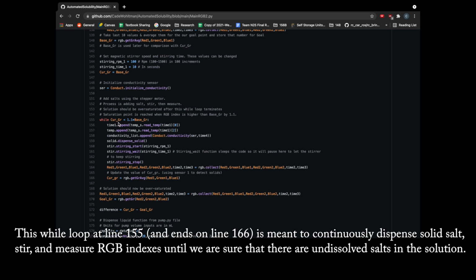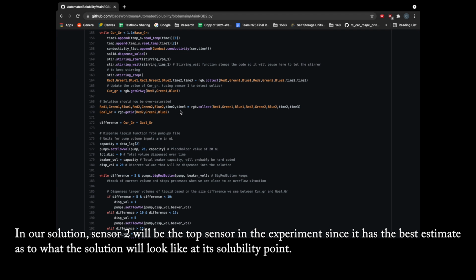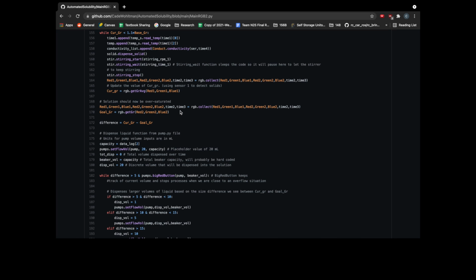This while loop at line 155 and ends on 166 is meant to continuously dispense salt, stir, and measure RGB indexes until we are sure that there are undissolved salts in the solution. As you can see here on line 170, we are now using sensor 2 to get the grayscale value and setting it as a goal. In our solution, sensor 2 will be the top sensor in the experiment since it has the best estimate as to what the solution looked like at its solubility point.